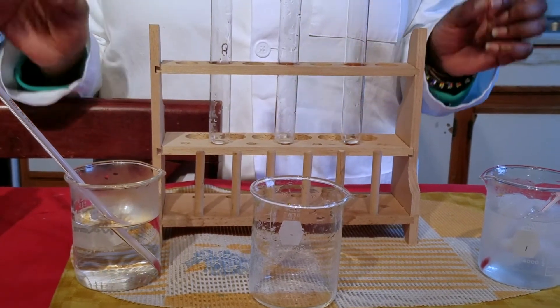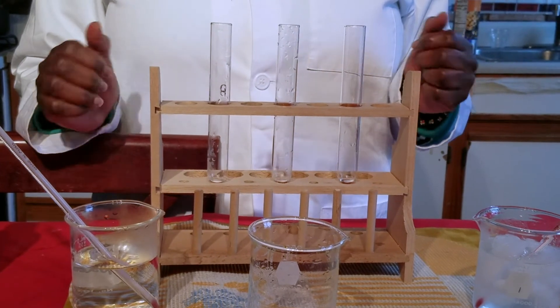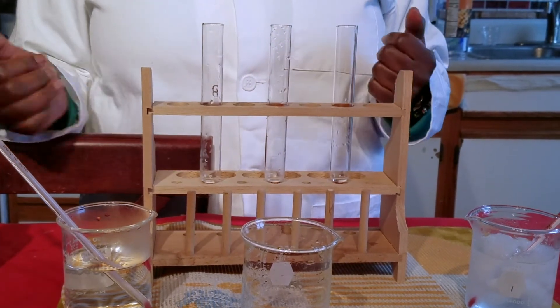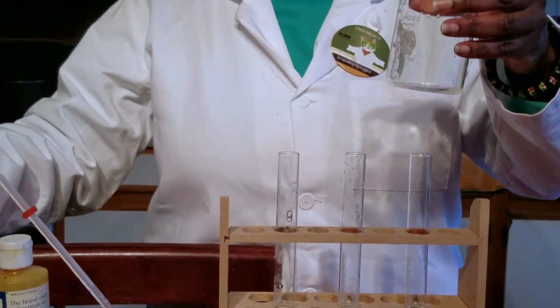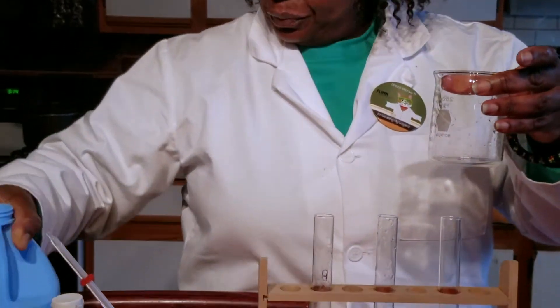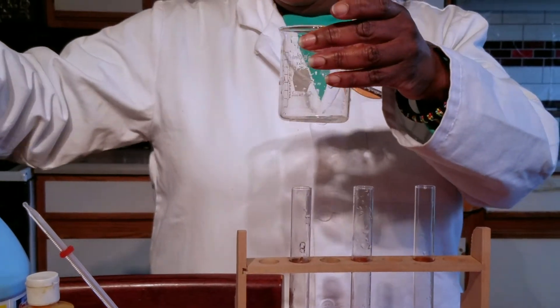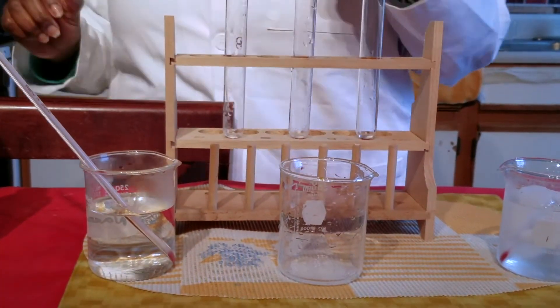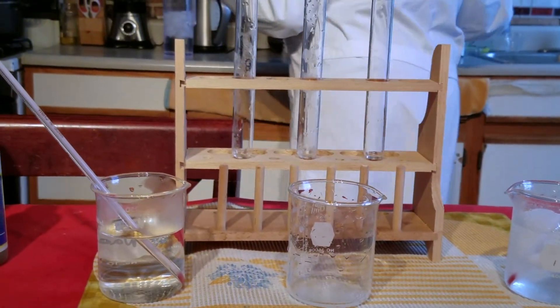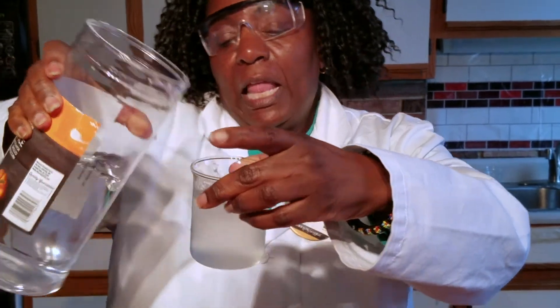The way that you can control the temperature is to have an ice bath and a hot bath. What we will do today is make a solution. We're going to take some common household starch and add a measured squirt. To this we will add some tap water, which will produce a cloudy solution.